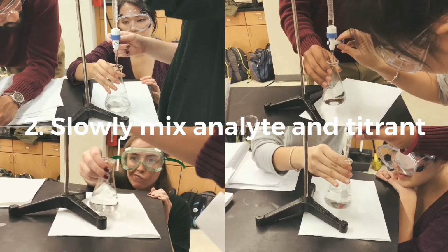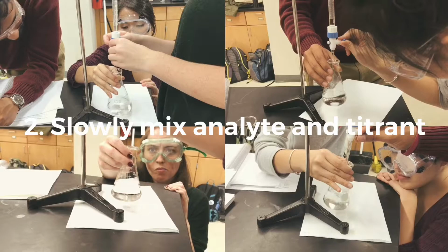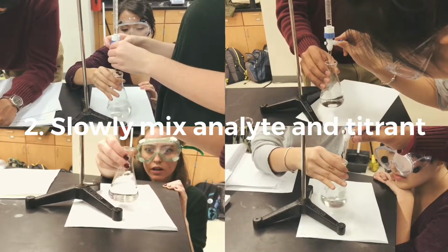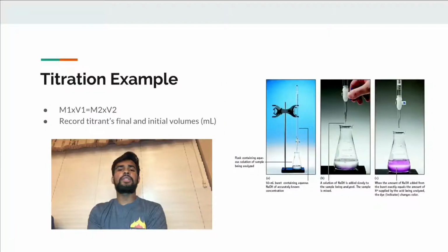To release the volume, slowly turn the stopcock to the vertical position while swirling the reaction vessel holding the analyte. Continue to titrate the solution until it turns light pink. Once the solution is turned pink, turn the stopcock to a horizontal position to stop the flow of the solution.